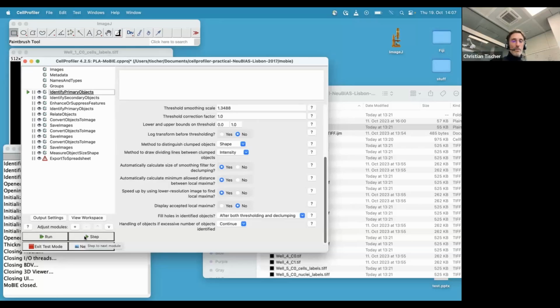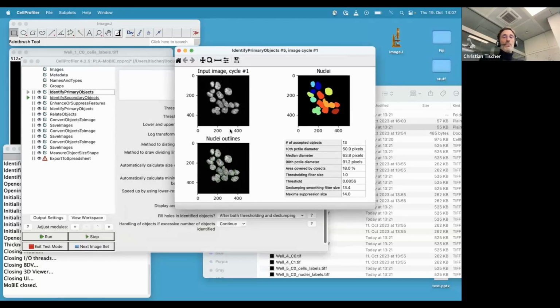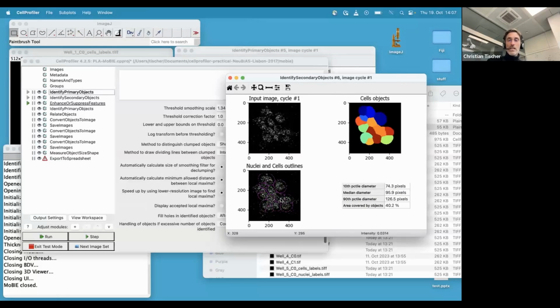So I use the fantastic test mode in CellProfiler. So we have images that have nuclei. We segment them. Then we do a simple segmentation of the cells by just dilating the nuclei. I'm going very fast because this is not supposed to be a CellProfiler course, right? So for this, there might be other tutorials, I guess.